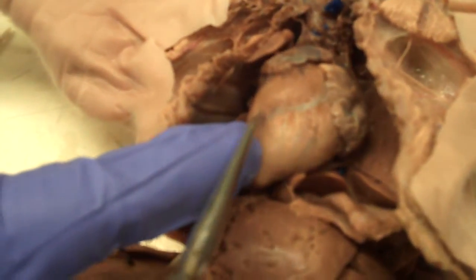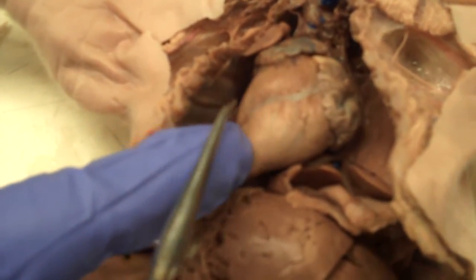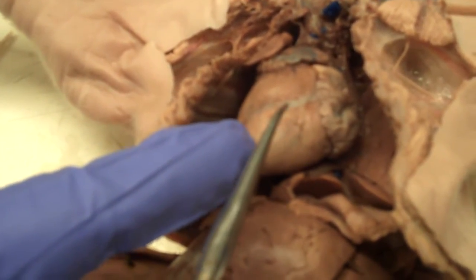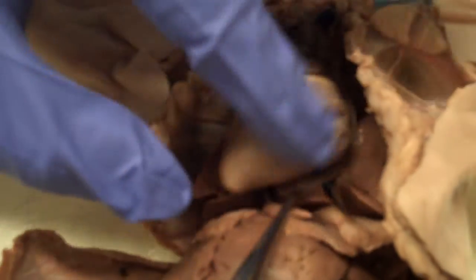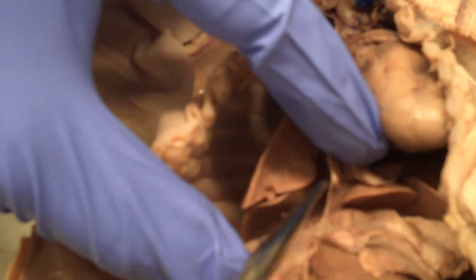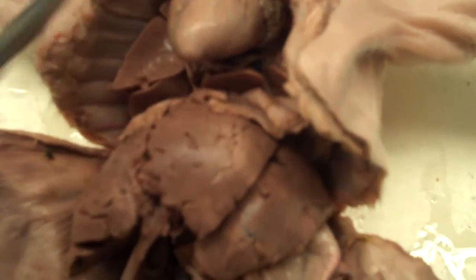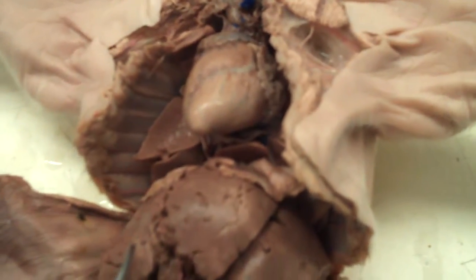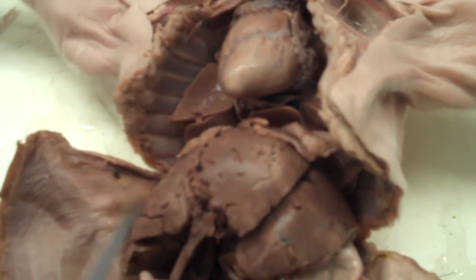We then have the heart. The heart is encased by the pericardial sac. We also have the caudal vena cava. The diaphragm separates the pleural cavity from the peritoneal cavity.